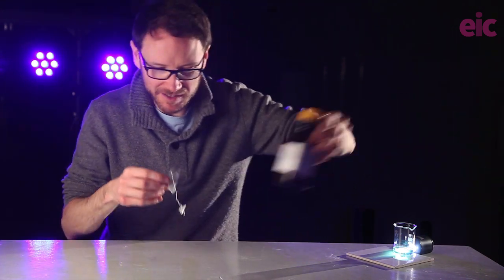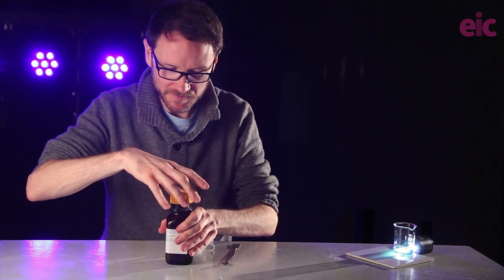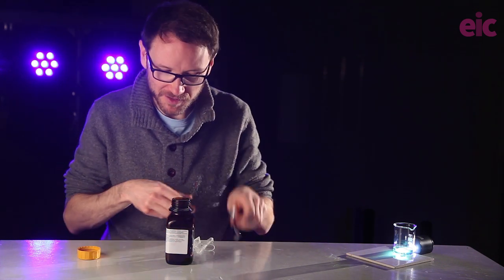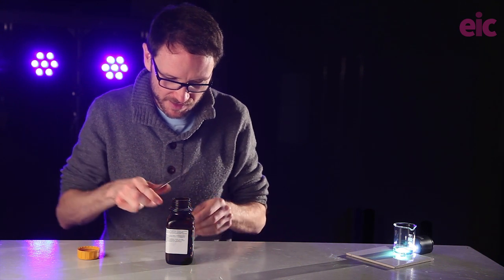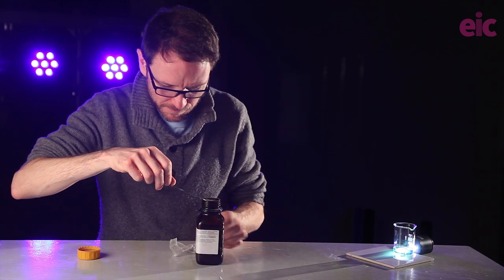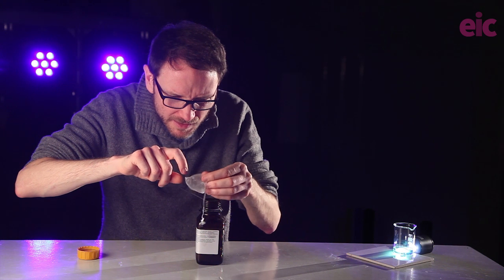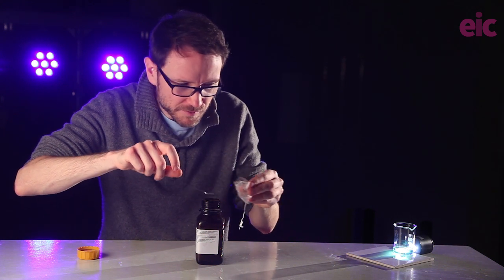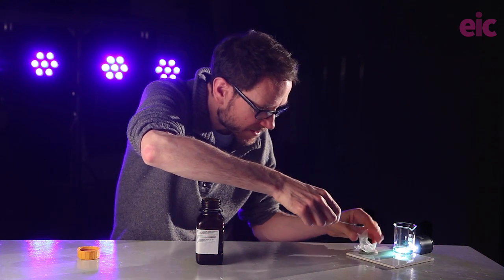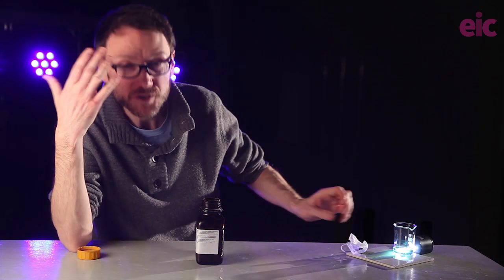So I've got some zinc powder, I've got my spatula, and if Mark's still out there, yes, these are still your pots we can spot here. And if I just get a little bit of zinc, pop onto the side here, and I've cut like a little hole in the top. That's beautiful. Straight through.